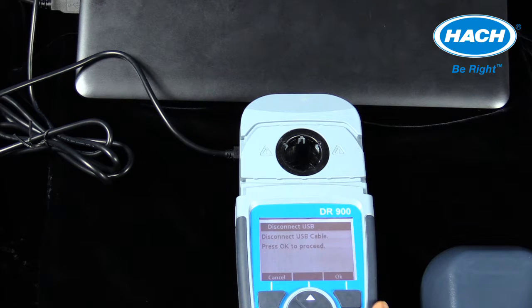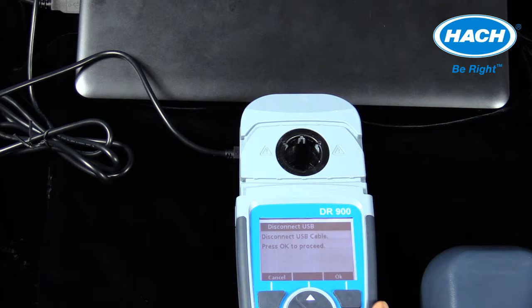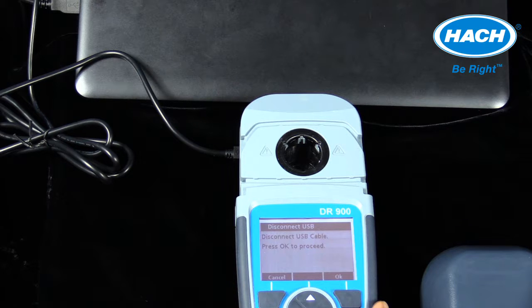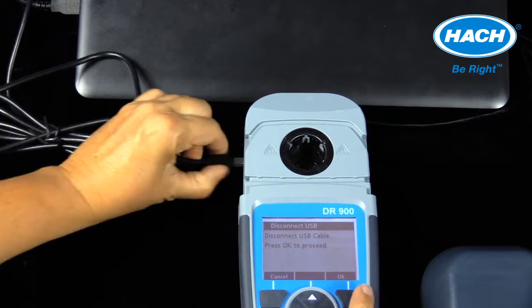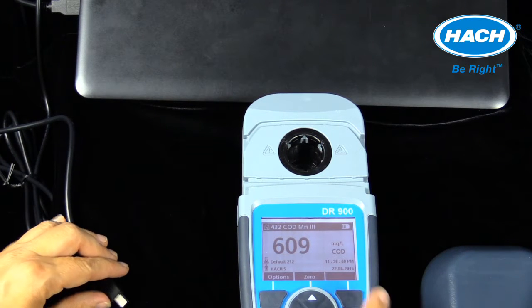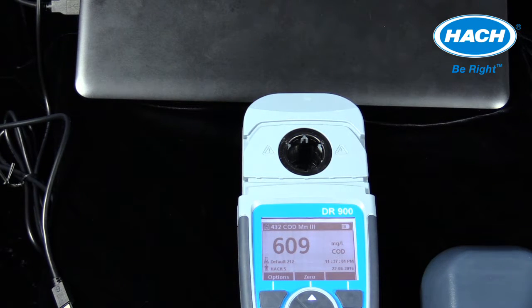The meter will then display disconnect USB and call for the disconnection of the USB cable, and press OK to proceed. Disconnect the cable and press OK. The meter will then return to the measurement menu and the last reading taken.